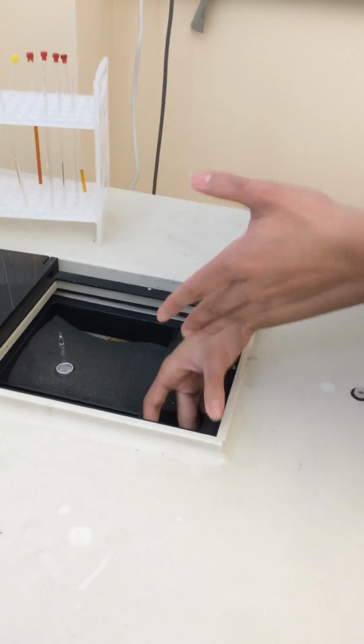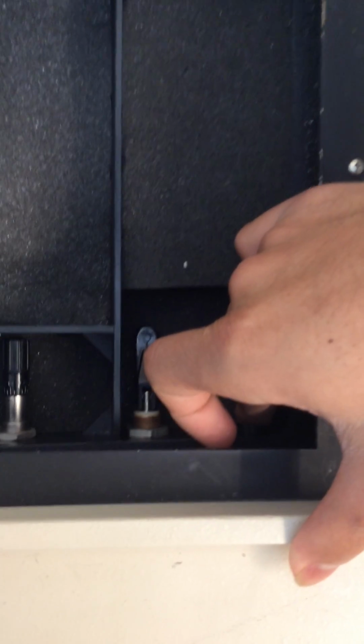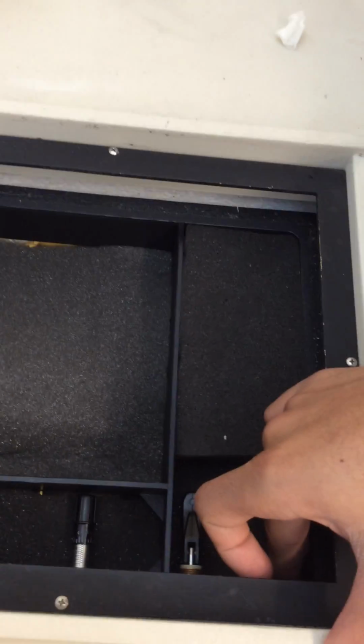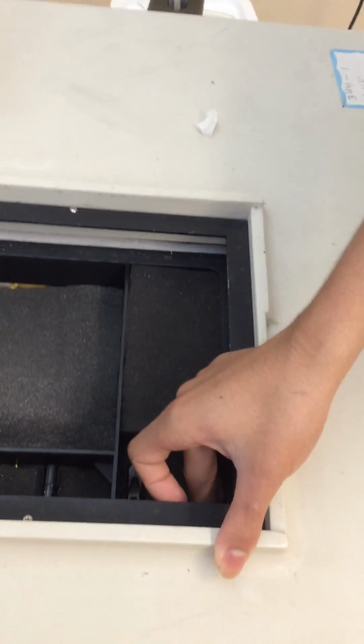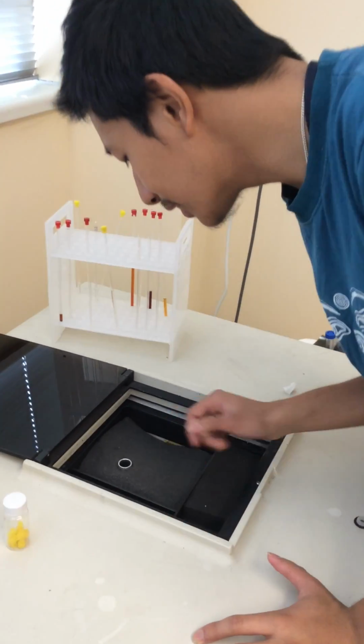So I just push this button here so that the sample goes down slowly. And once it goes down inside, it starts resonating, it starts flipping at a high frequency. So there I can see my sample spinning around. And now as it starts spinning, I'm gonna show you how to get the NMR spectra.